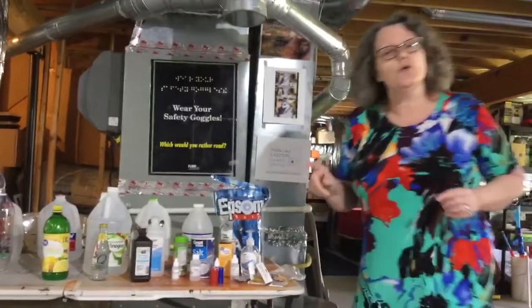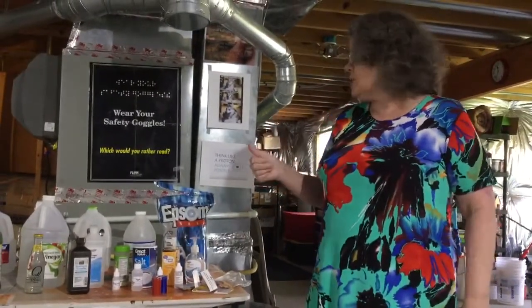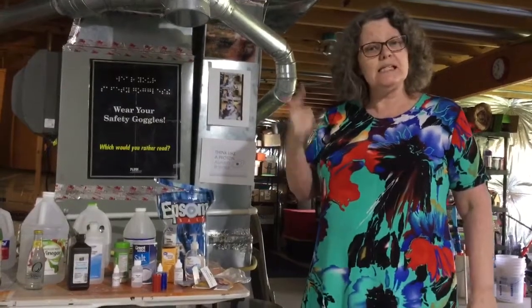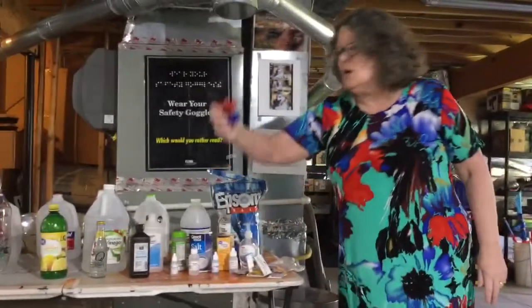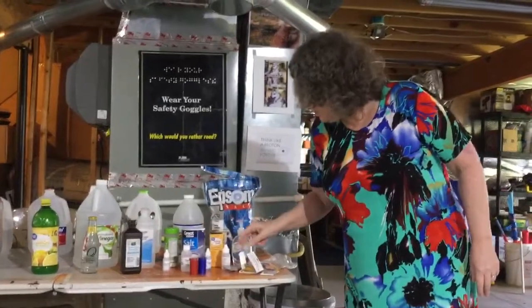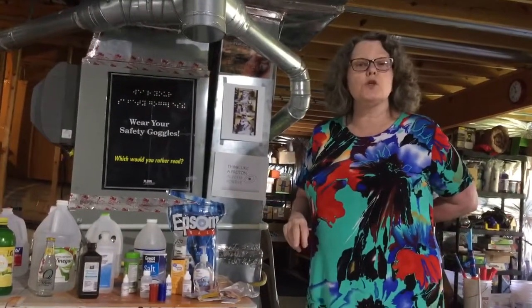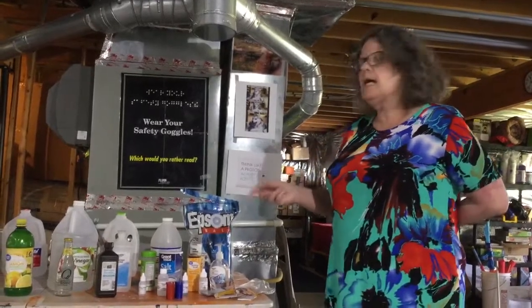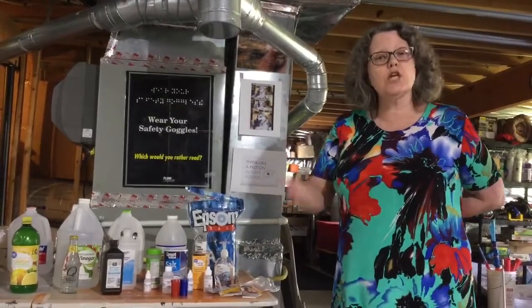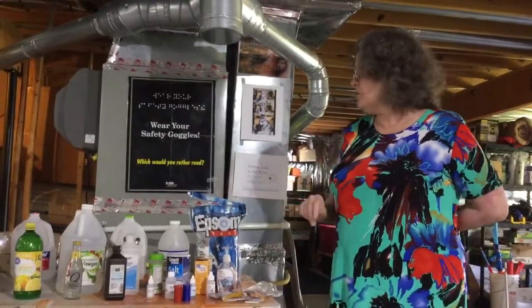So when you do your lab 10.1, make a list of the chemicals that you have. You need to make a prediction. Do you predict whether it's an acid, base, or neutral? Then test it. You may test it with litmus, or you may test it with pH paper and write down whether it is acid, base, or neutral. And then make a general summary. In general, what kind of substances are acidic? In general, what kind of household substances tend to be basic? That's what you're going to do for Lab 10.1.